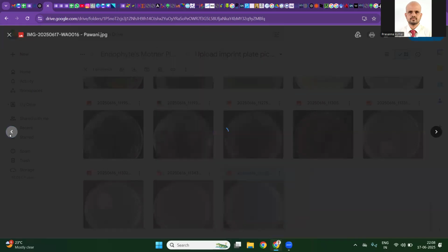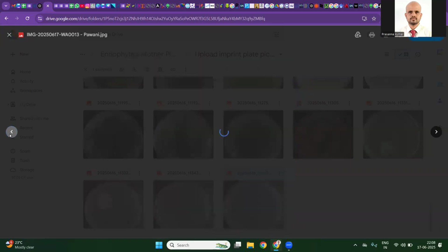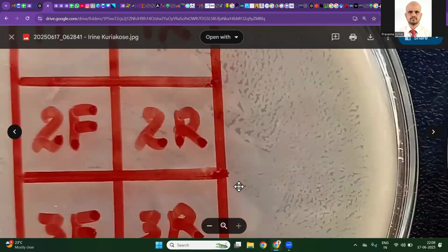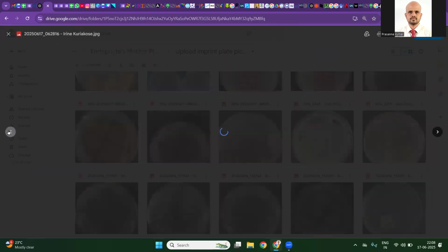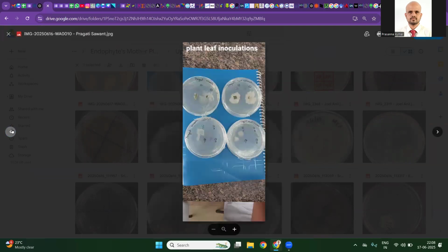Again, the imprint plate has growth, so we need to control the imprint growth. Again, same here, we have growth. Bacillus swarming everywhere, can you see? They are just swarming everywhere, happily swarming. This is mainly because the laminar is not prepared well, or you have introduced contamination while working. Here the imprint looks clean.